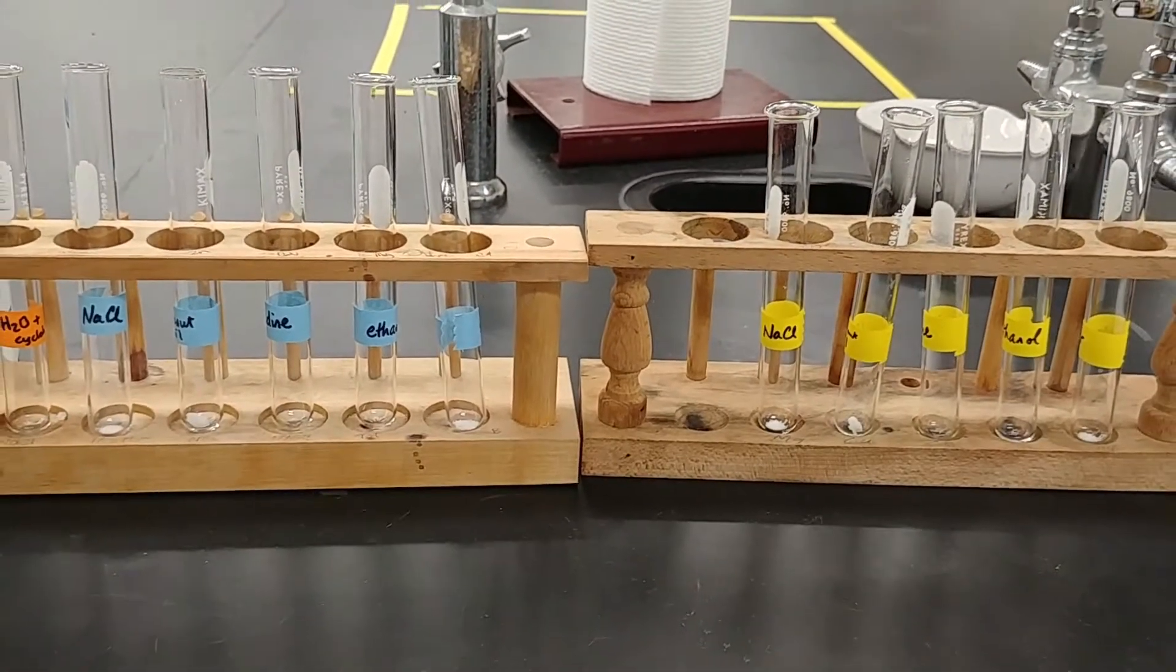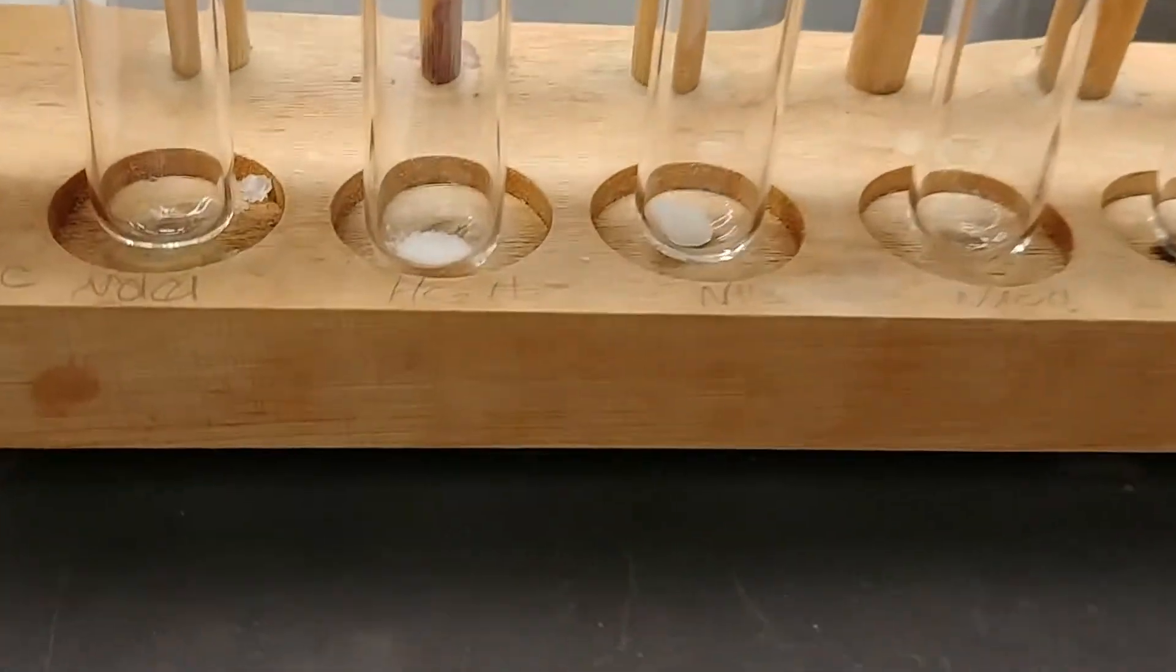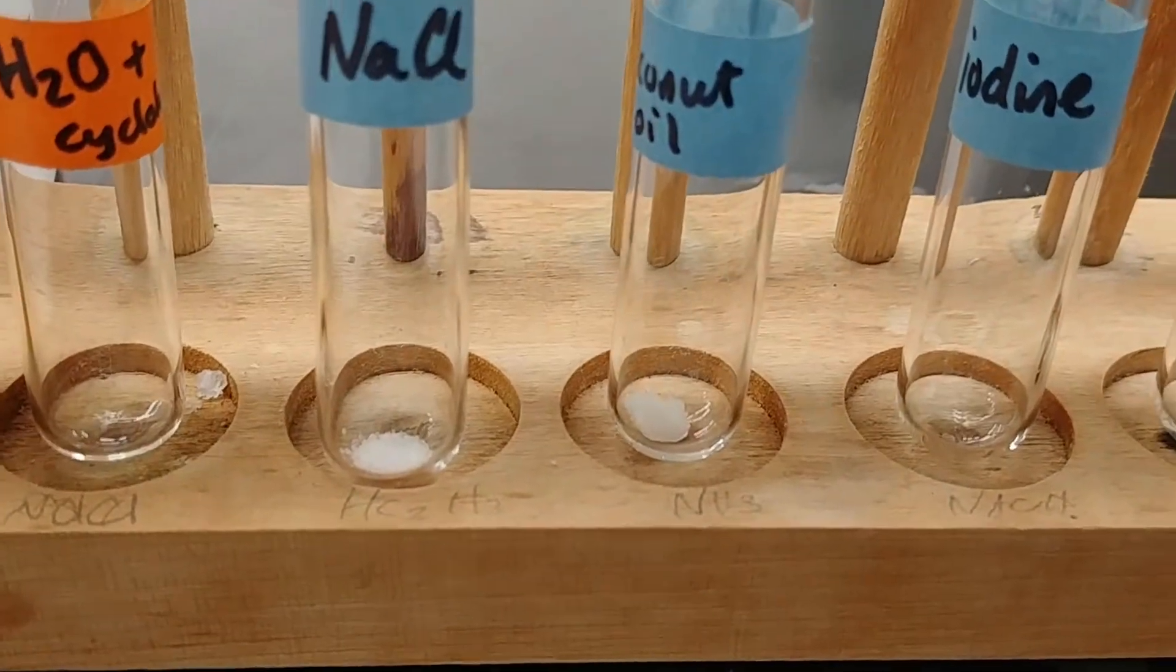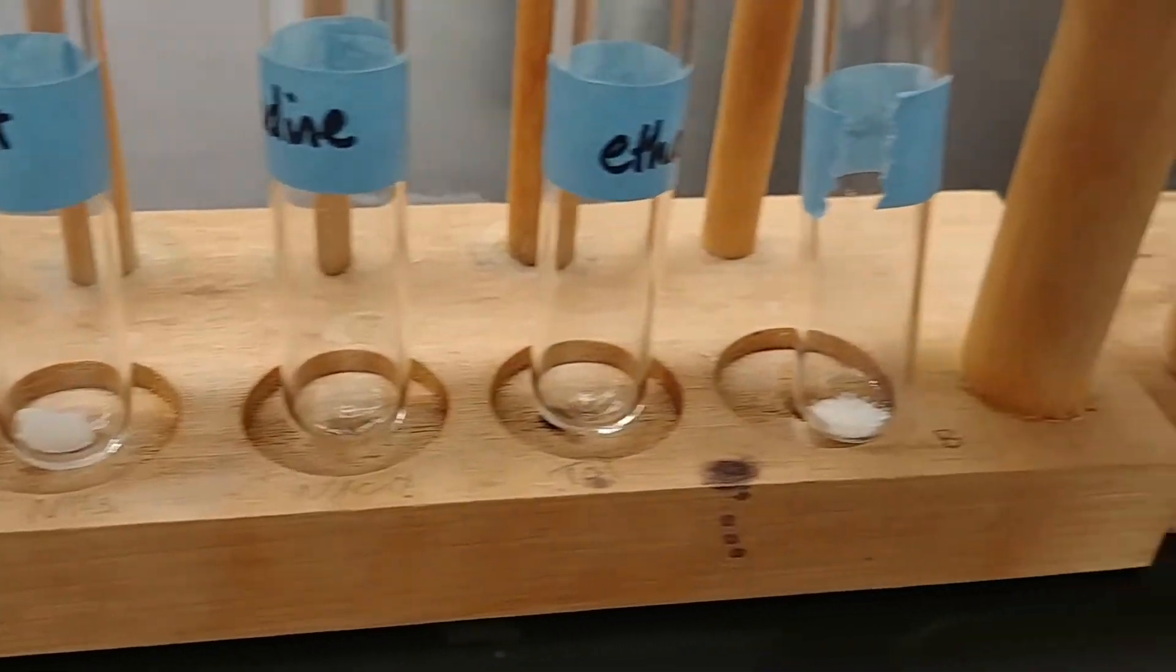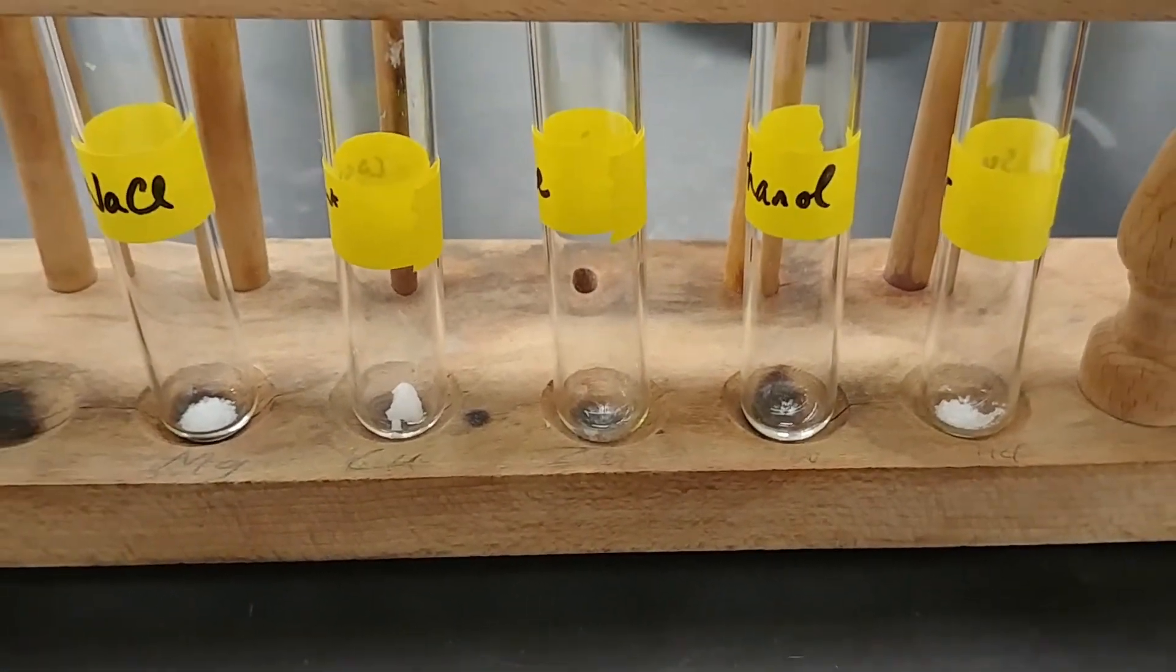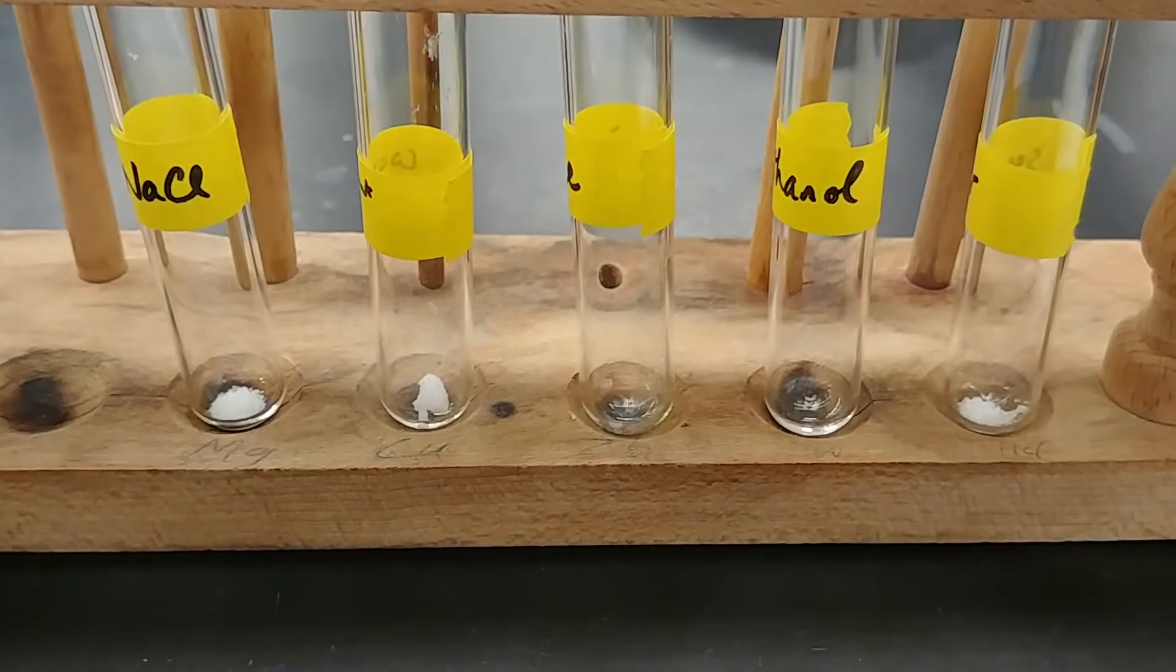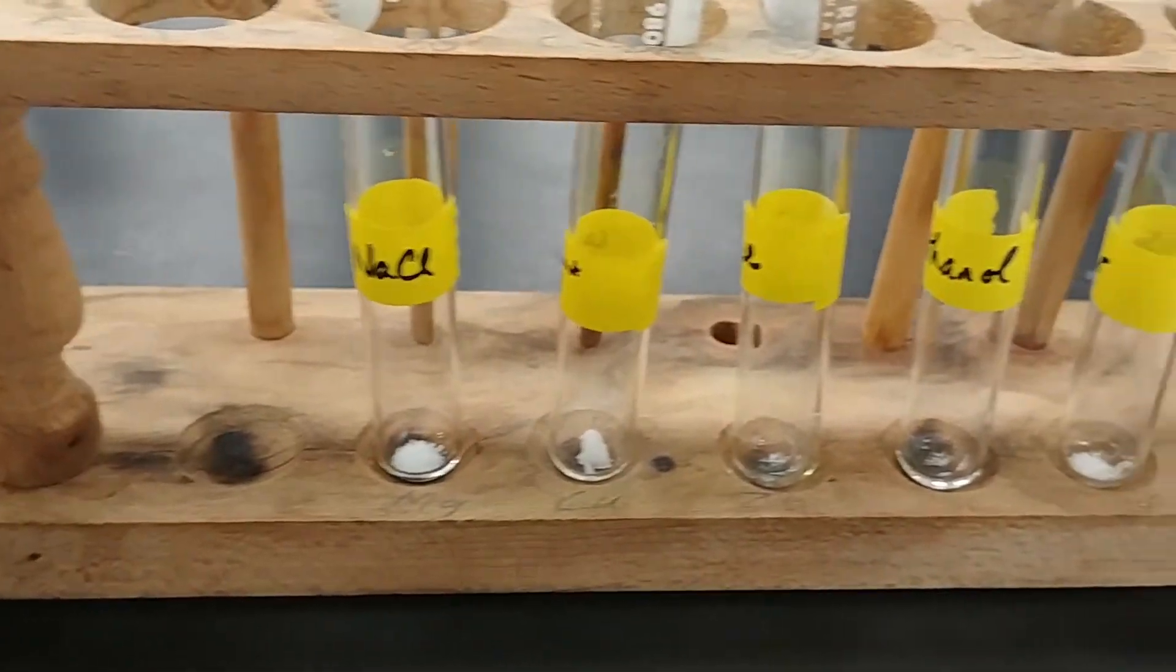I've already set up a couple of test tubes with small amounts of the solid in each one. Notice that I'm using very small amounts. This is because every solid is going to run into something called a saturation point. If we oversaturate our solution, not all of it is going to dissolve.